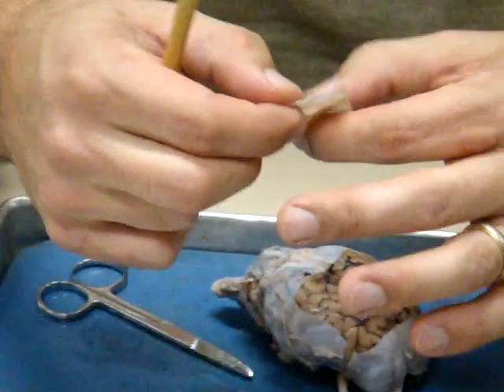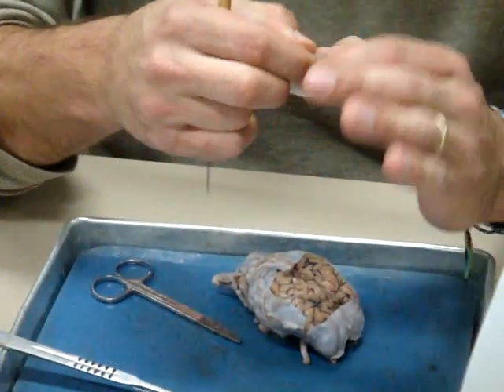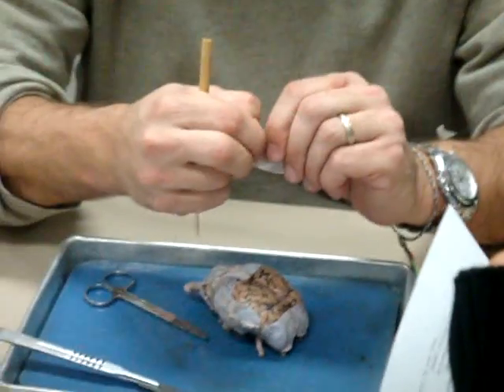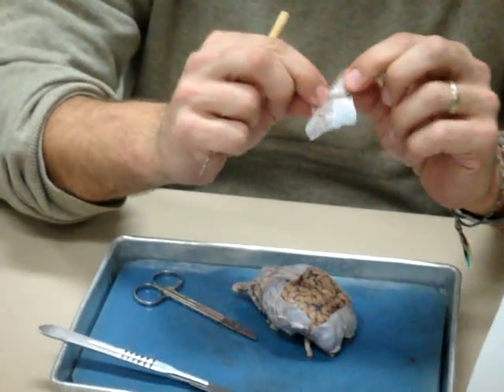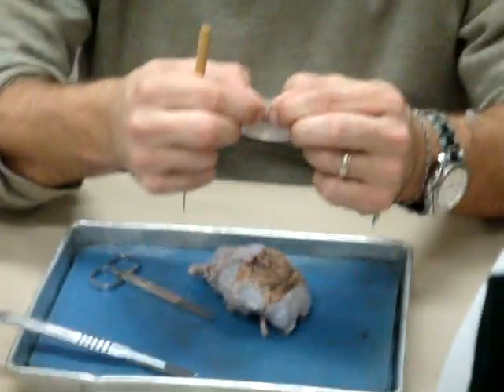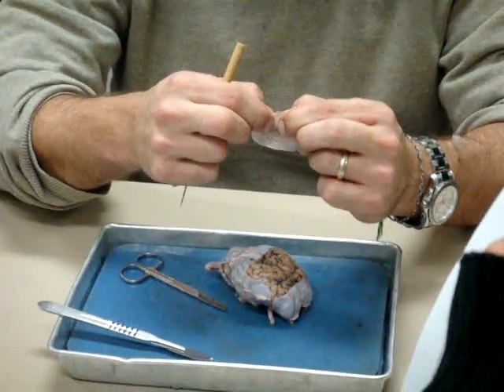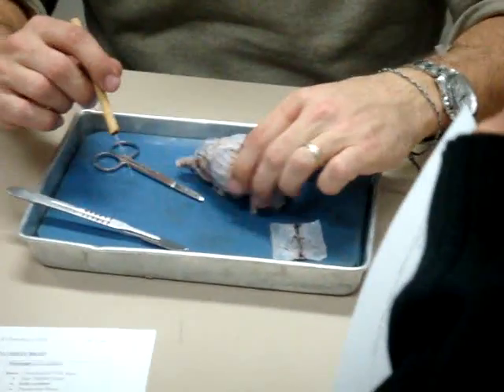Okay, and you can also kind of see, this one's ripped a little bit, but if you try to rip this dura mater, it's very difficult. I mean, I was pulling pretty hard there. I can't really rip that tissue. It's very strong. It's flimsy this way. It's not elastic, it doesn't stretch, okay, and very, very tough. That's why they call it dura mater, tough mother. Okay, so it's a good protective thing for the brain.